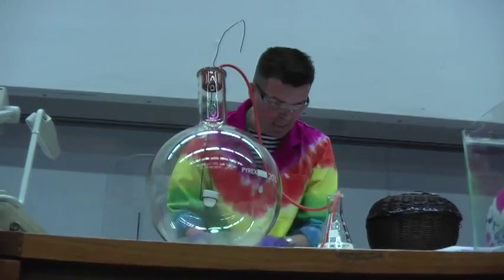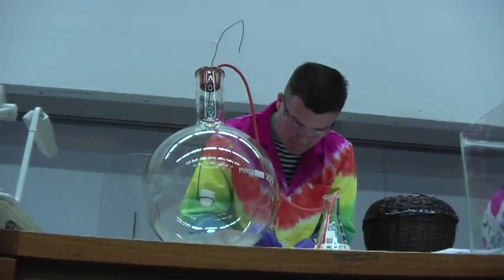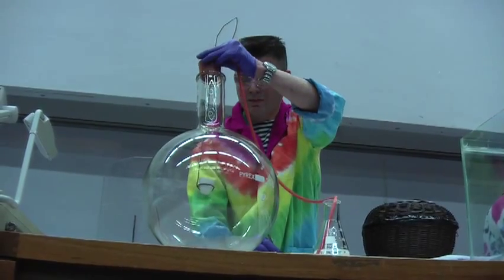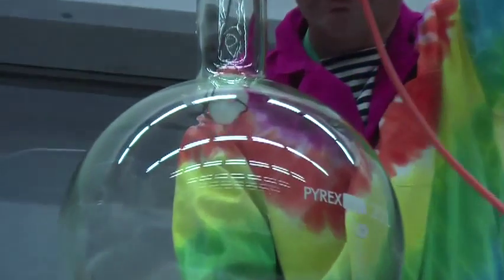So just be a little bit careful about it, and just take my little piece here, and I'll pull this up first. Give it my crucible nice and ready. In it goes. And then I'm just going to reset and cover the phosphorus up. Dave's heating up a proper rod for me.